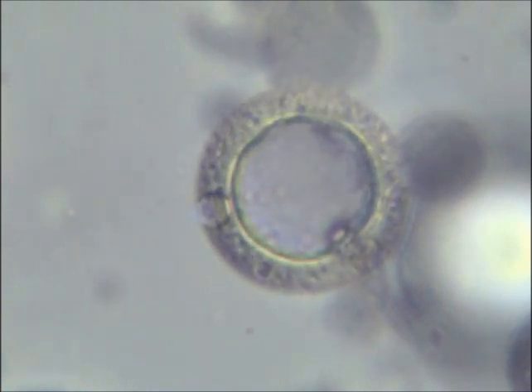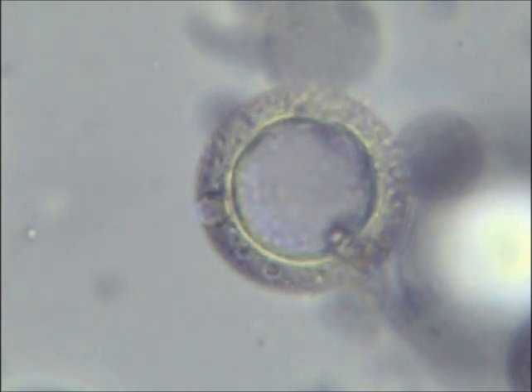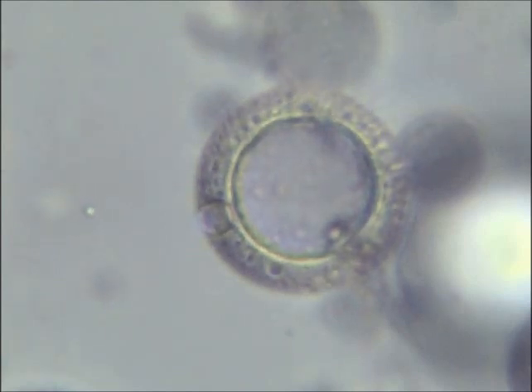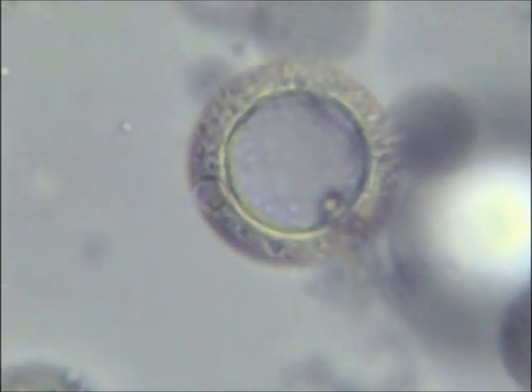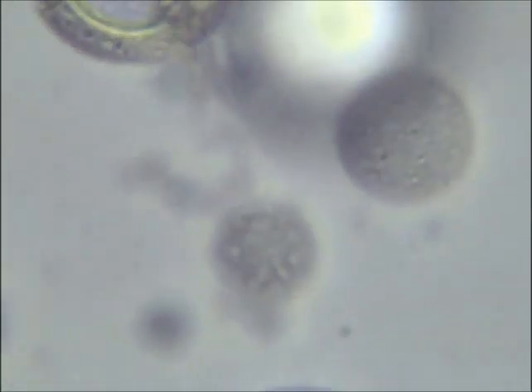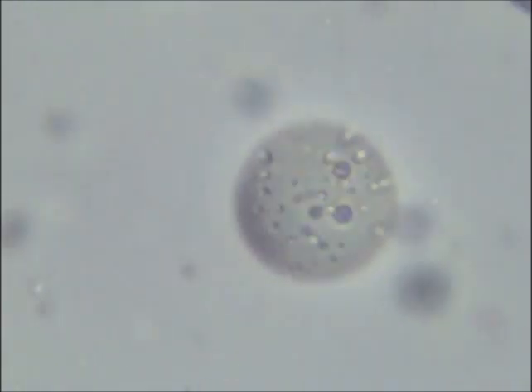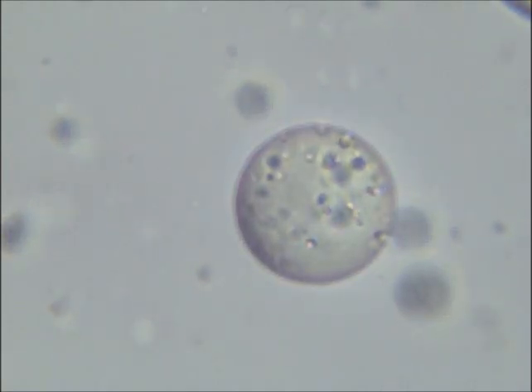Secondly, I've learned about something known as chromatic aberration. Chromatic aberration happens because light rays passing through a lens are sometimes refracted at different angles. This results in the color of the image being distorted, or an image showing color where there is none. I am convinced that this is what happened with my last video.